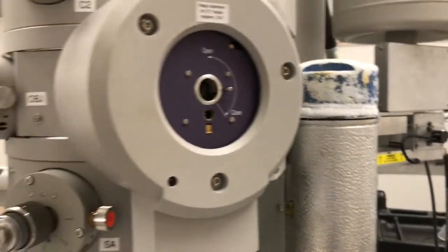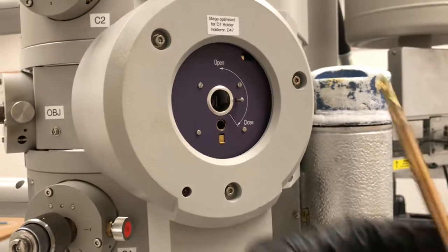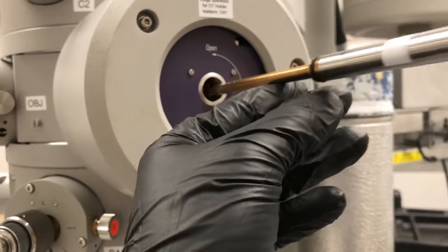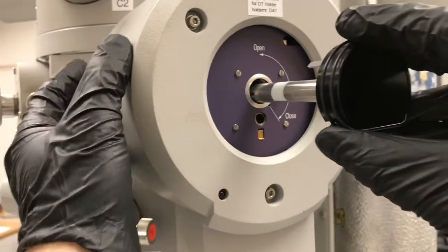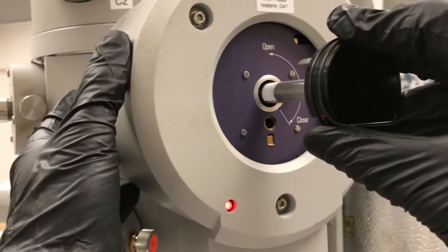There's the pin line. Line up the pin with that line, resistance, push.